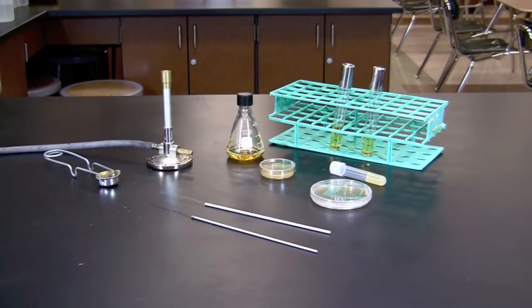In this video you will learn how to perform streak plate technique. The streak plate method allows isolation of a single colony from a bacterial culture by splitting the plate into quadrants and diluting the bacteria repeatedly as the loop is streaked through each quadrant.